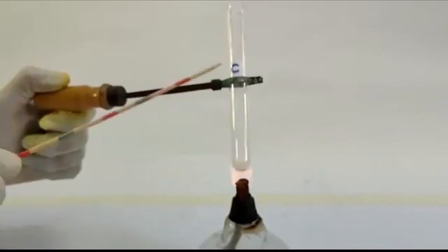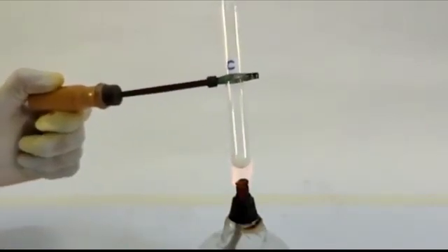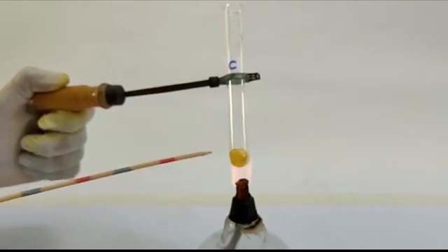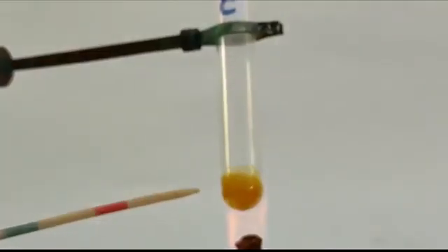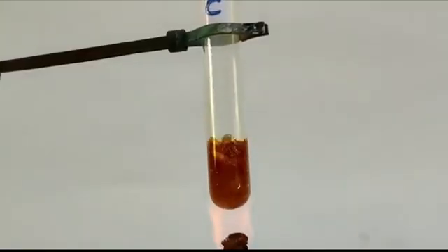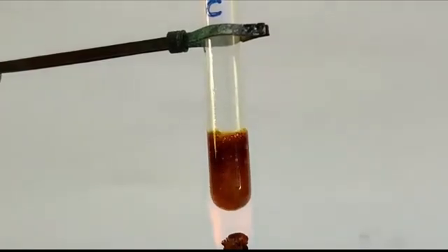Now, let's observe activity C. While heating sugar in test tube C, observe the effect of heat and record your observation.